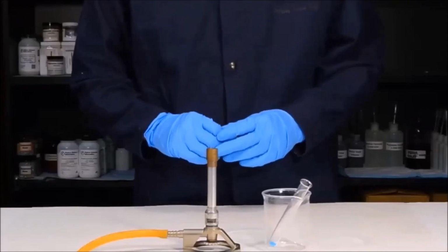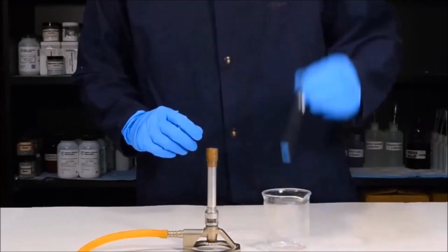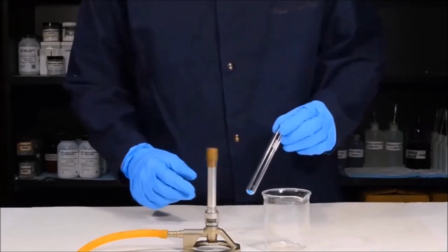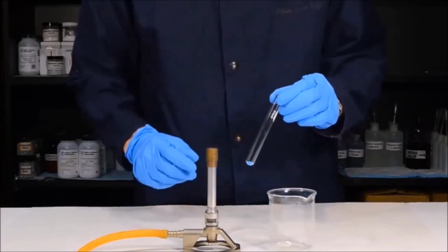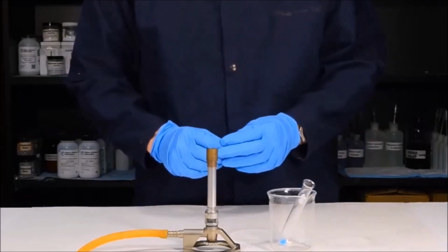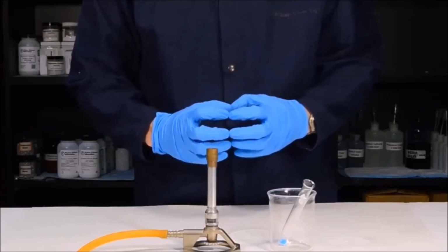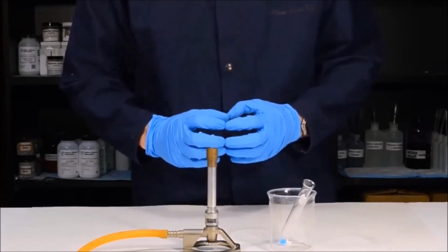Before dehydrating the copper sulfate, it's important to fill the test tube with the appropriate amount. Because test tubes are an irregular shape, it can be difficult to measure their mass on a balance. In order to measure the mass of a test tube, simply place a beaker onto the balance and tare it. Then insert the empty test tube. Once you have the test tube inside of the balance, you can record its mass. Take the test tube out, add approximately 0.3 grams of copper 2 sulfate, and then simply record the mass again. Make sure you know which test tube is which.